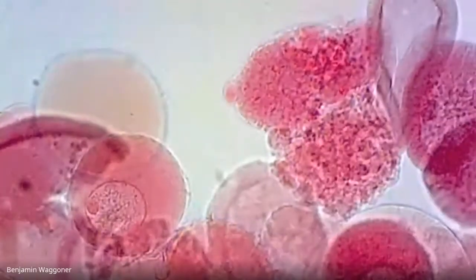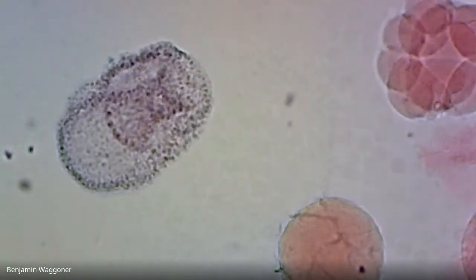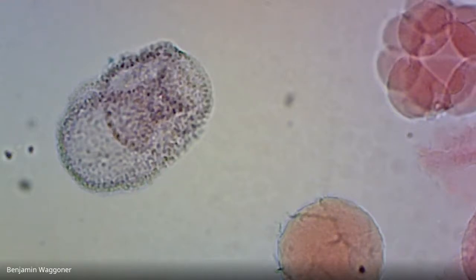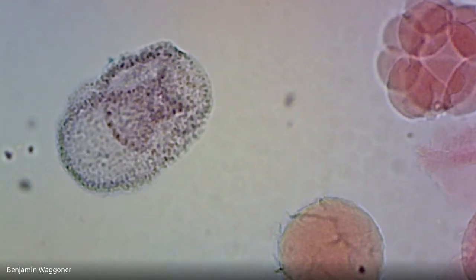So yeah, I think that one there, the gut may have broken through, and the whole thing is beginning to change shape into a larval type that in starfish is called a bipinnaria. So that's one where not only do we have the gut forming and complete or nearly complete, but this is about the stage where the critter is going to break out of the fertilization membrane and start swimming around on its own and start feeding.